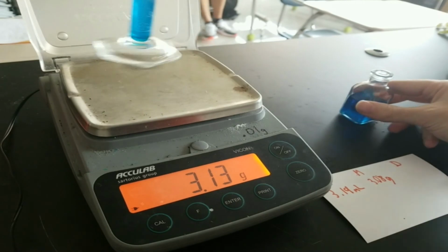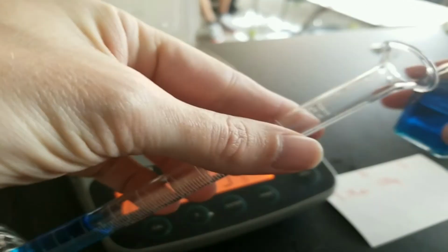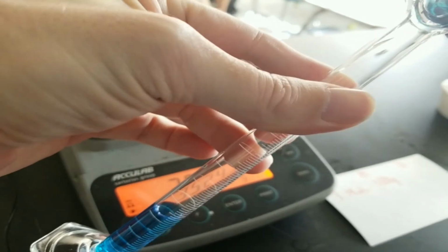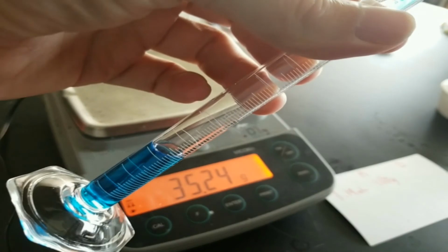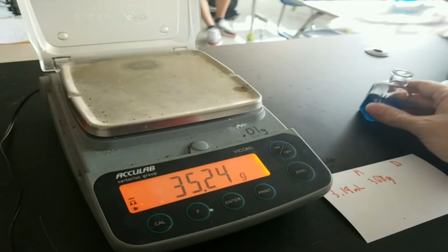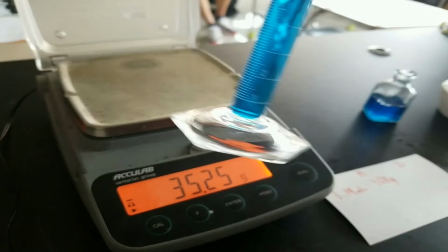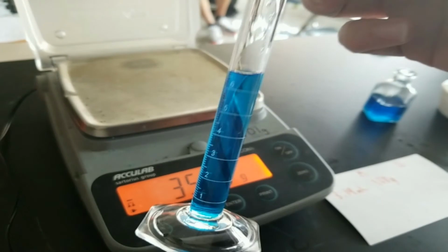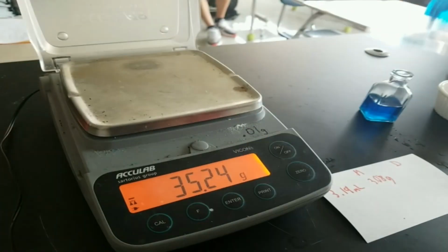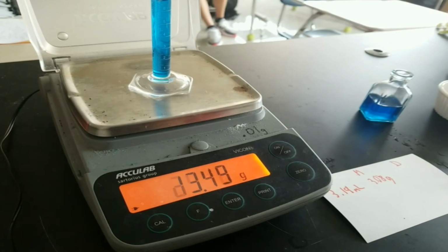So I'm going to take it off of the scale. I am not going to zero the scale. I'm then going to add about 3 more to it. I want to do it at an angle. Oh no, I poured way too much in. Oh, that was only somewhat deliberate. As you can see there, I got significantly over the 6, but that's okay. Because remember, density really doesn't matter as to what you do.